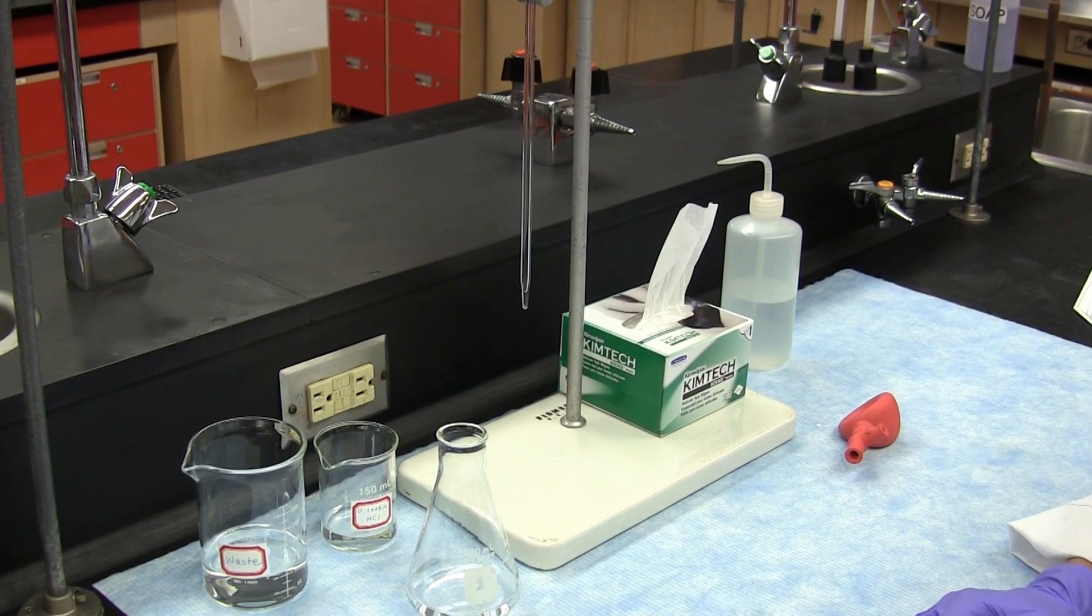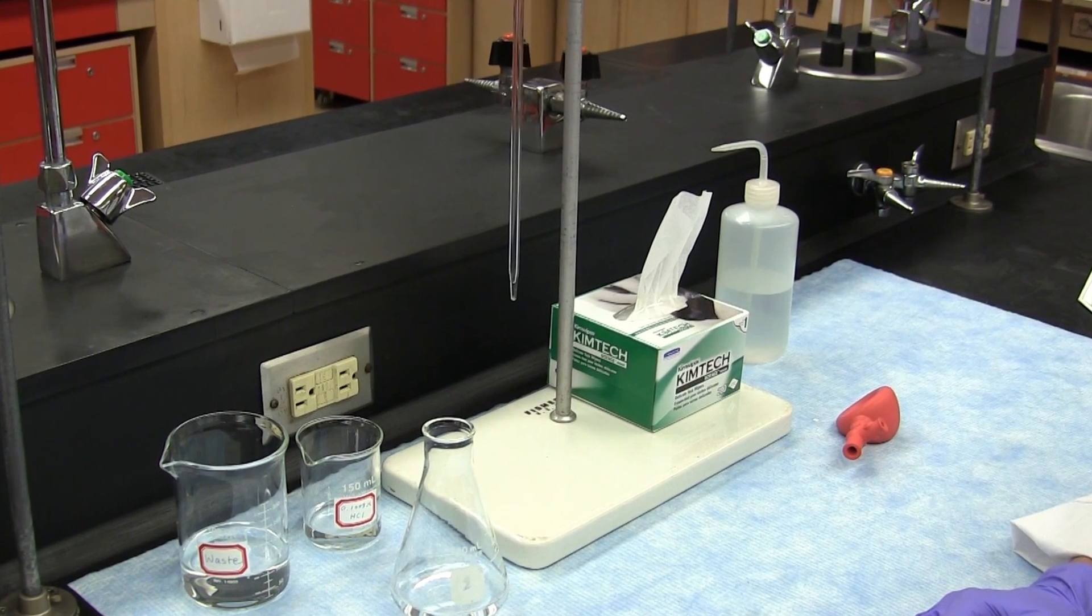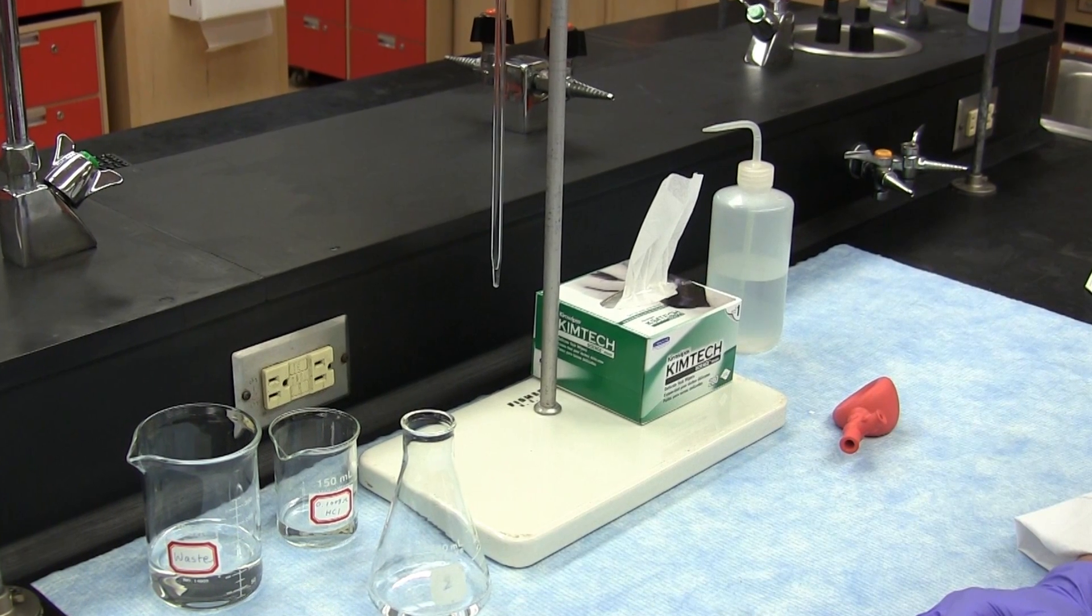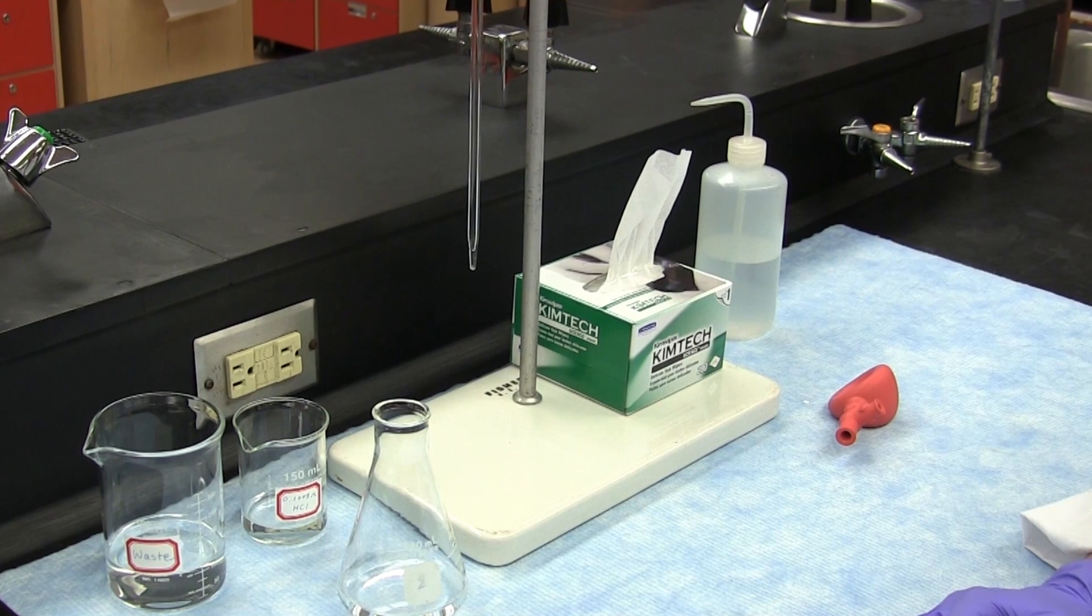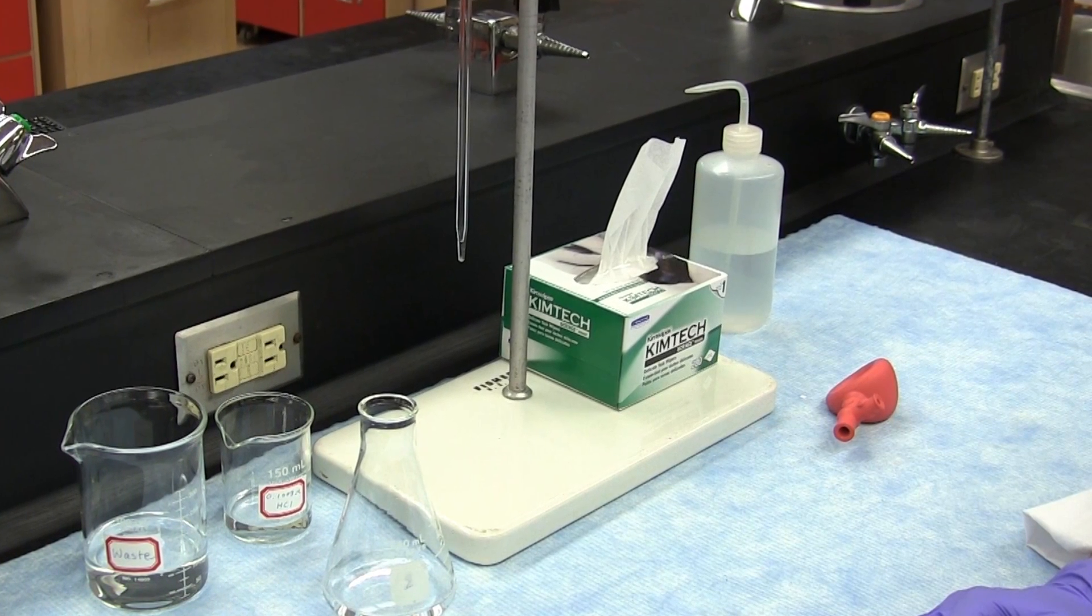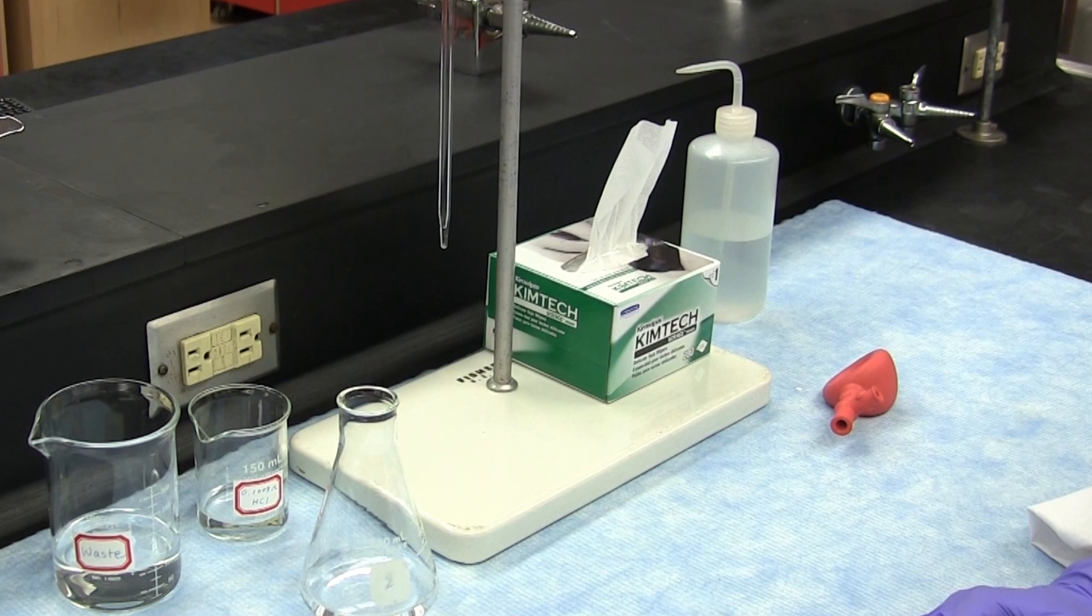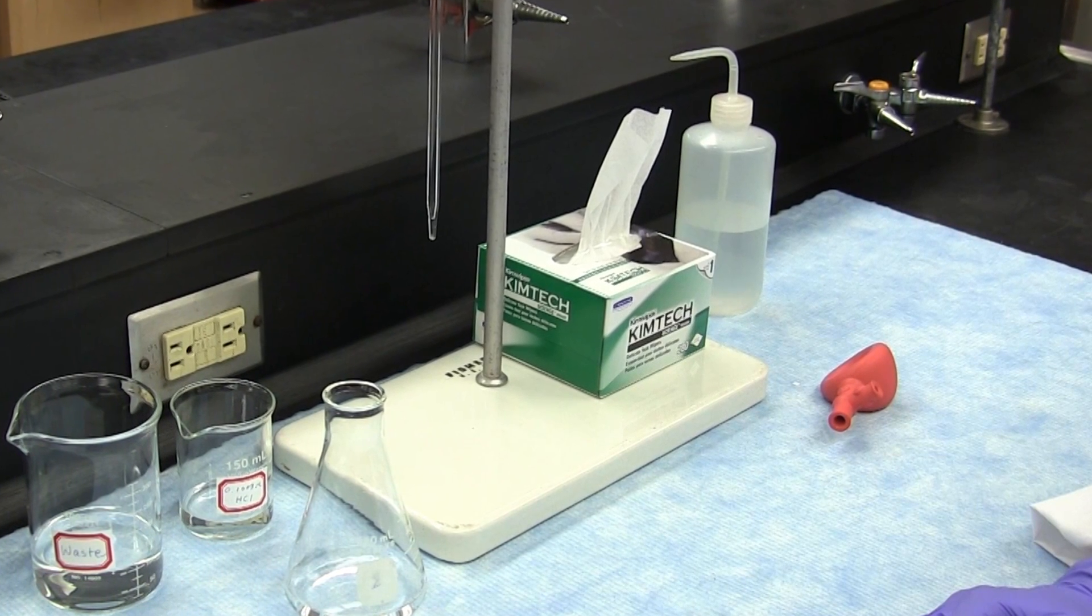This concludes this short video on the use of the volumetric pipette. Remember that what we have shown you here provides basic practical information and your instructor may want to slightly modify some of the procedures shown depending upon the experiment you may be doing at the time.